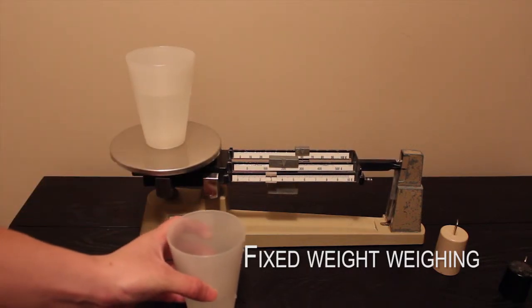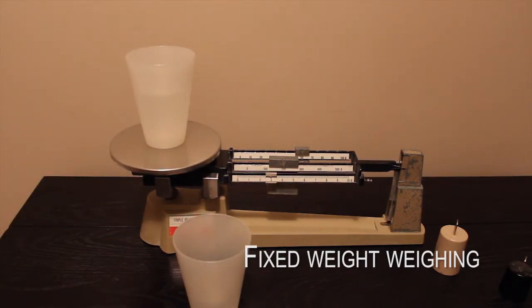The scale is now in balance. The cup of water finally weighs exactly 263 grams.